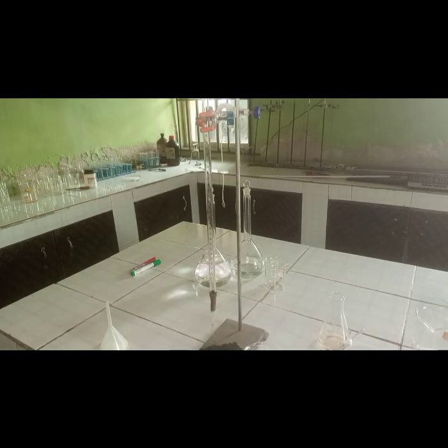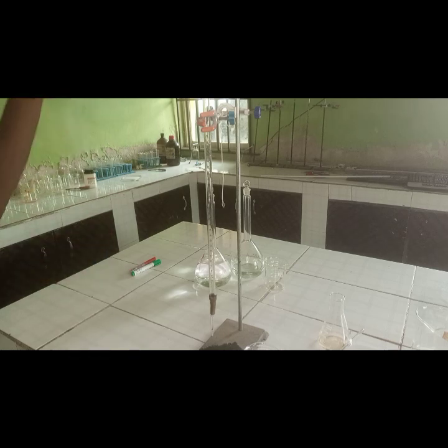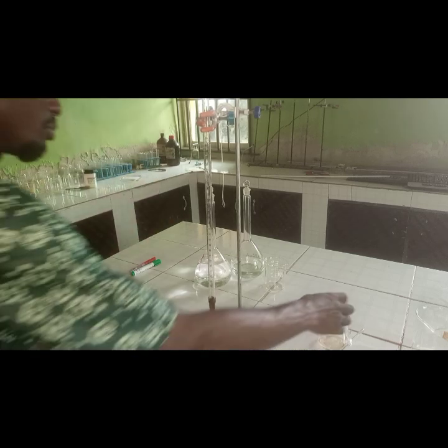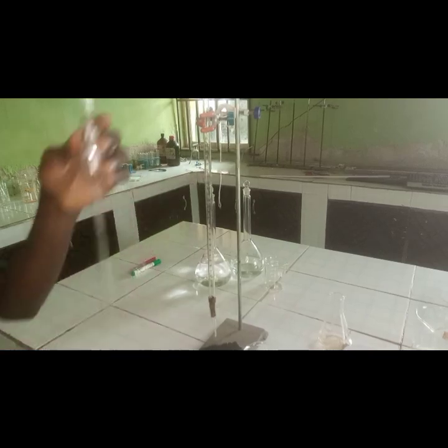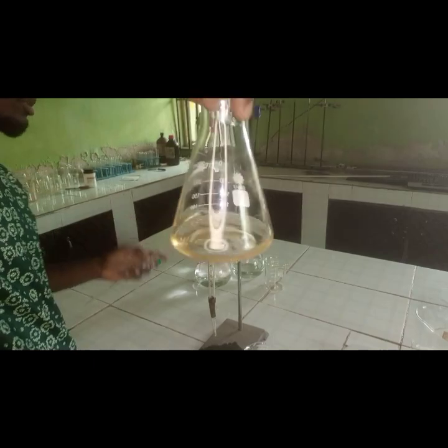Guys, following the instruction as given in the sample question, we are going to refill this burette using our funnel there. So we're going to refill the burette up to the zero centimeter marked points here. And then we prepare the base of 25 into the conical flask. And you see the color of the methyl orange indicator in the basic solution.